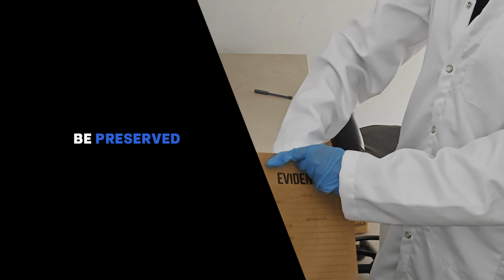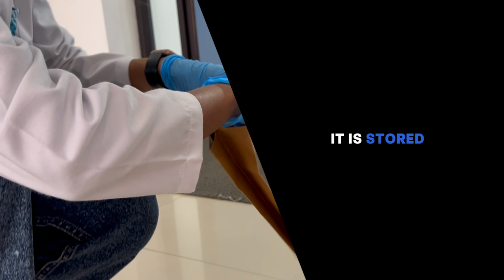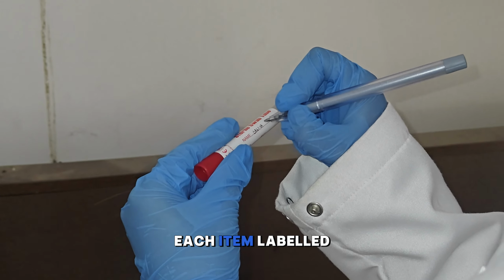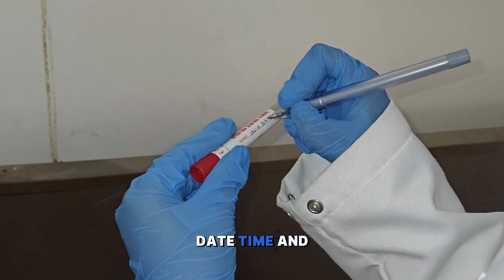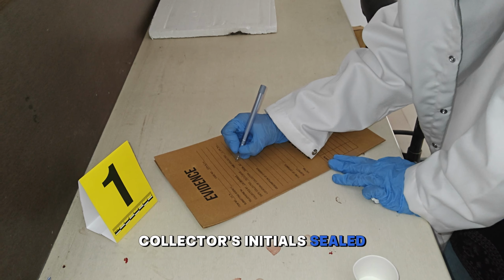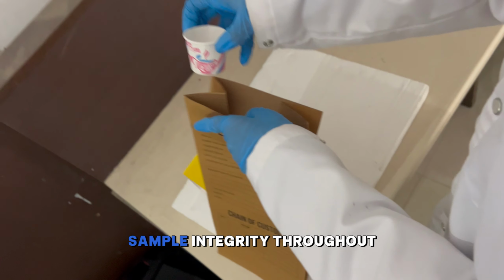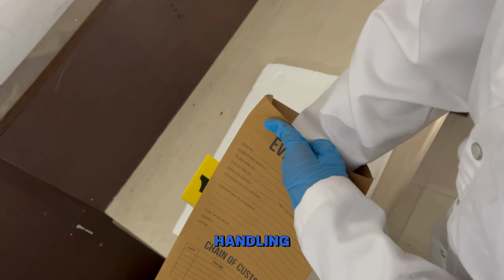Collected evidence must be preserved according to protocol. It is stored in a breathable paper bag or envelope to prevent moisture retention. Each item is labeled with case details, date, time, and collector's initials, sealed, signed, and documented in the chain of custody record, thus maintaining sample integrity throughout handling.